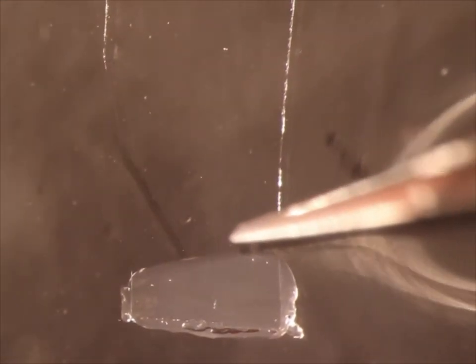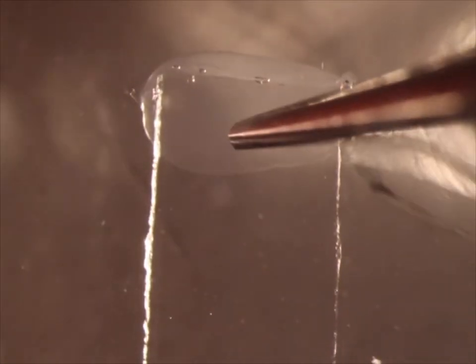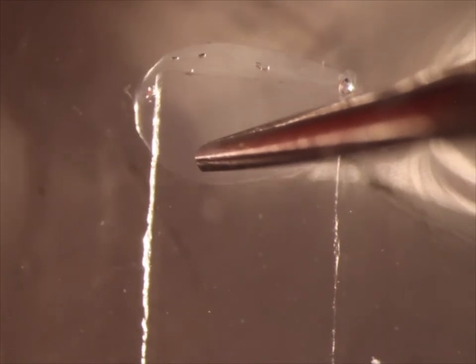The explant should be placed pigmented side up and covered with a glass shard with vacuum grease on the edges. This should be gently pressed down, but only from the ends, not over the actual explant.